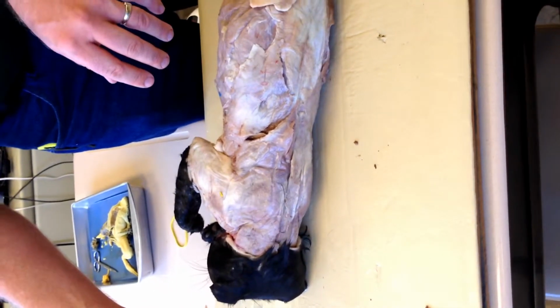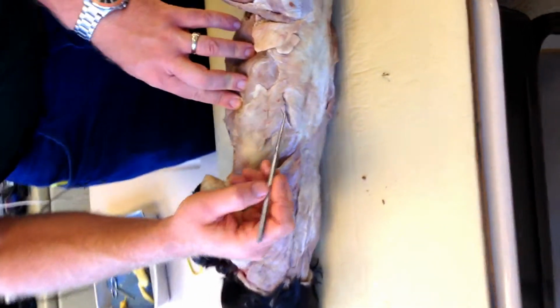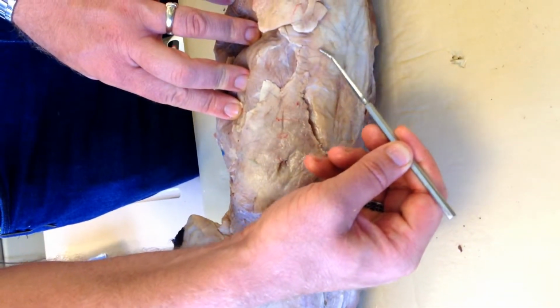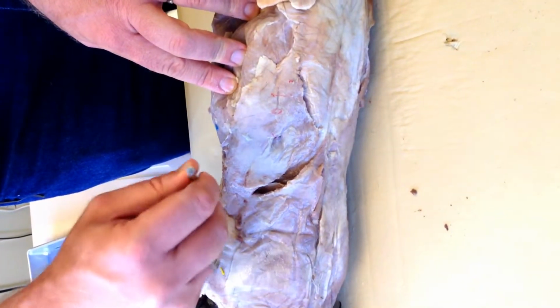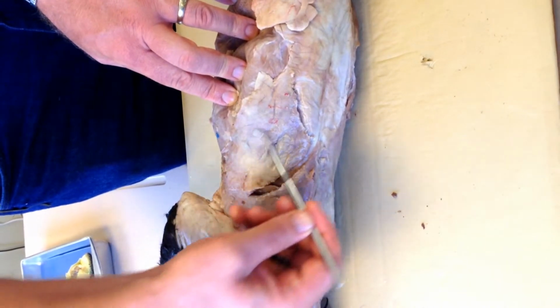There you go. Welcome to the kitty. You're a pretty kitty. On the back of the cat and on its side, there's this large muscle that starts in the small of the back and wraps around the top and attaches up underneath the arm here. What is this muscle? This is 22.